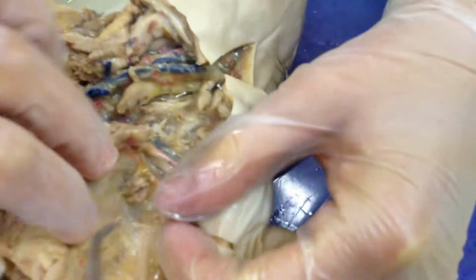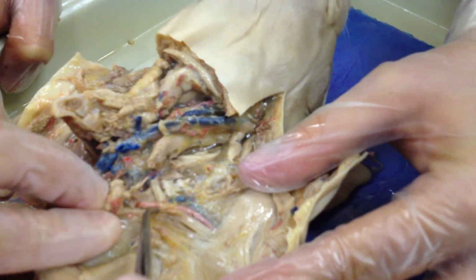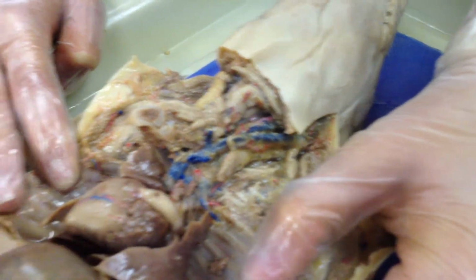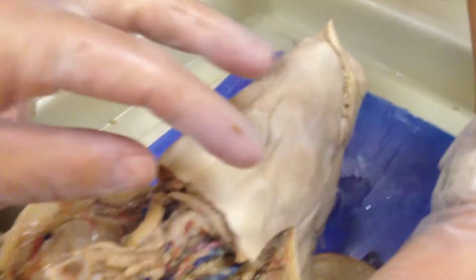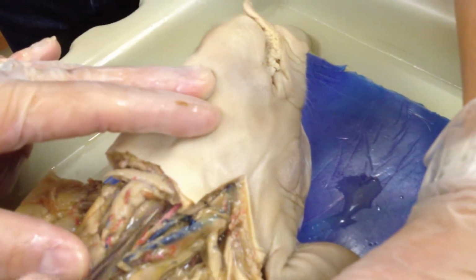Okay, so I'm just going to look at the little piggy's left, and this is the subclavian artery right here, and the subclavian vein was right below it. But I had to fold those ribs back in to find the subclavian, all right? Common carotid arteries right here. I'm only again going to do one side, and the common carotid is right here.